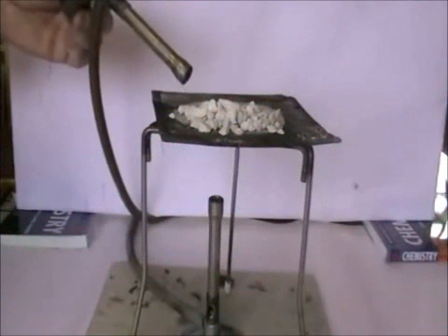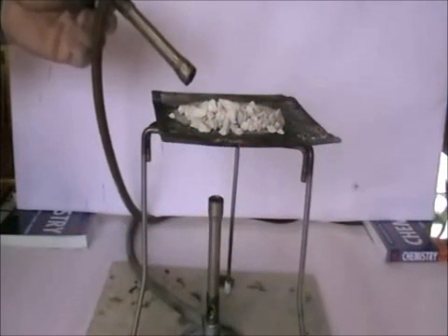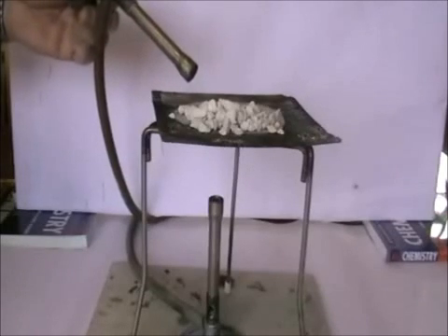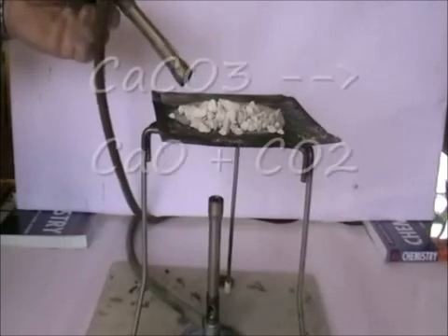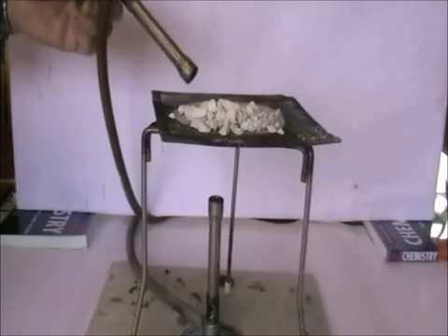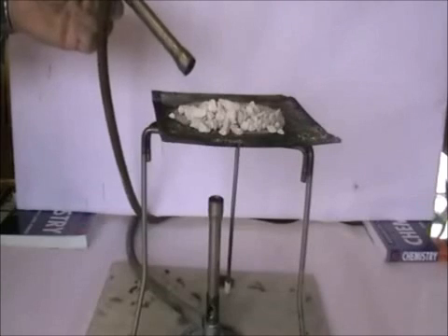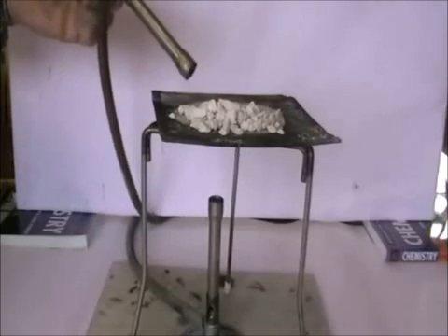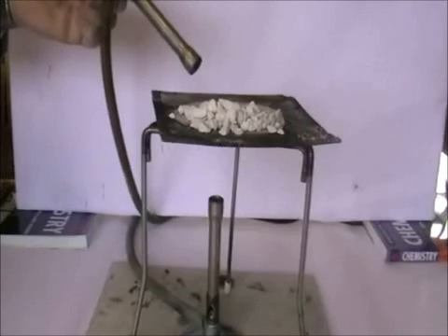As I do so, the heat is going to act on the calcium carbonate and decompose it — break it down — to calcium oxide and carbon dioxide gas. There will be very little to observe in this reaction, since calcium carbonate, the starting material here in the form of limestone, is white. And the product of the reaction, calcium oxide, is also white.